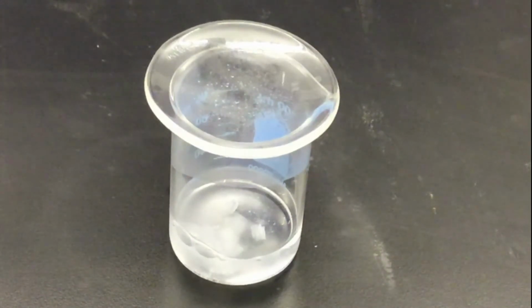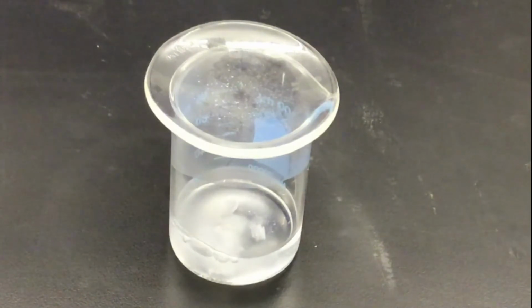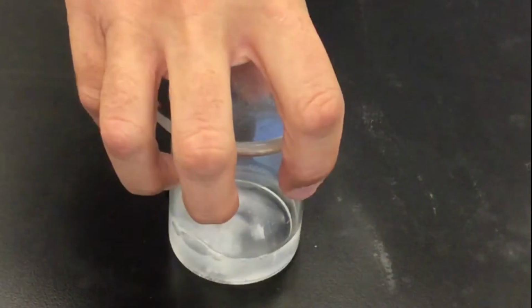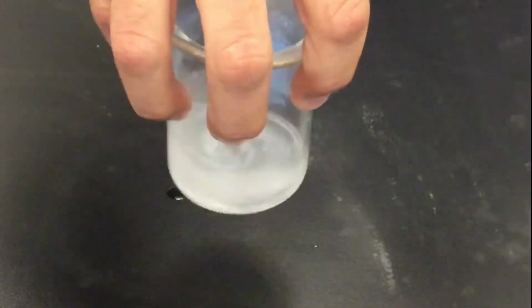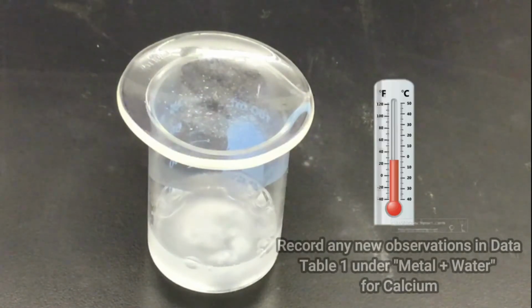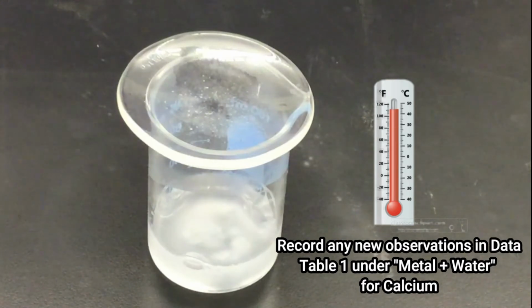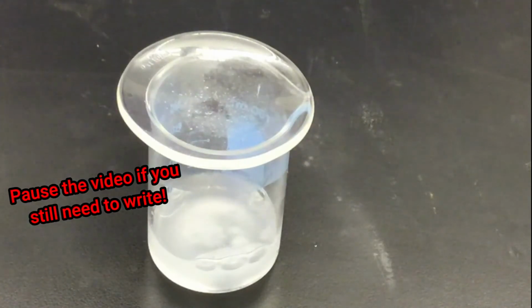Now, along with checking for the production of a gas here, which I think is pretty evident, another test that we could do is to feel the bottom of this beaker to see if any heat energy is released. And I will tell you, after touching the bottom of the beaker, that it is warm. So there is a release of energy that's also occurring here. Again, another indicator of a chemical reaction.